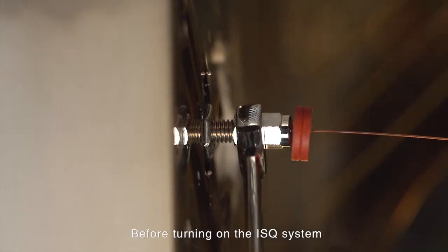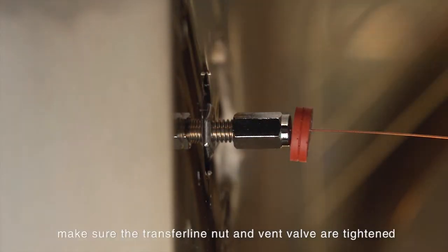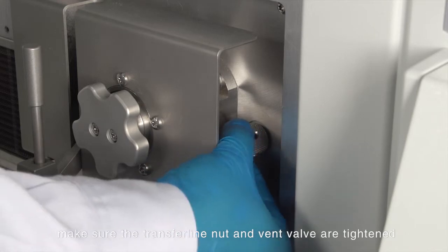Before turning on the ISQ system, make sure the transfer line nut and vent valve are tightened.